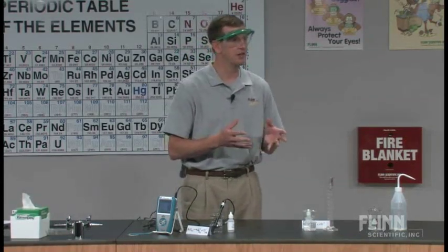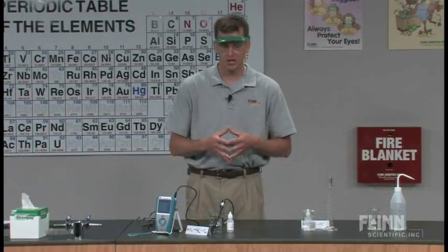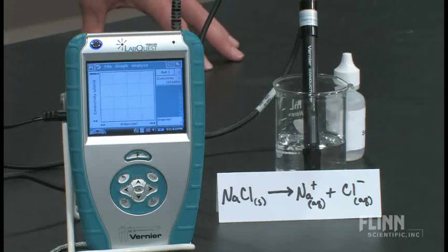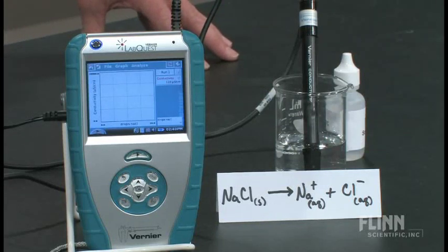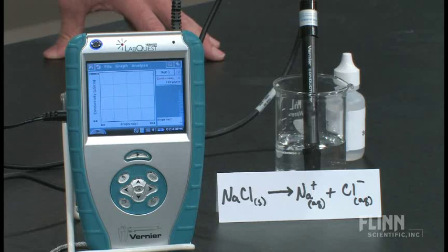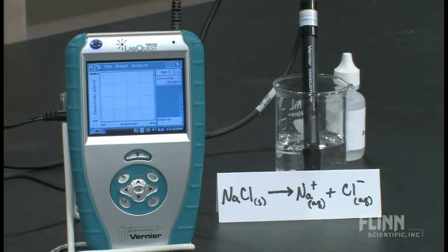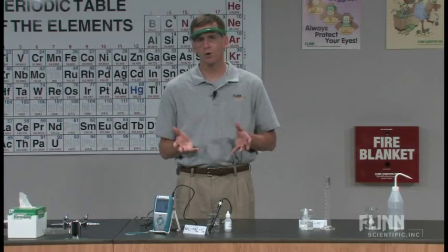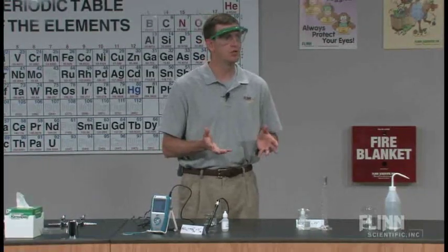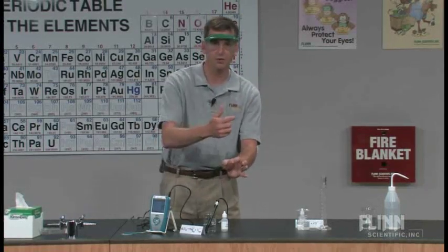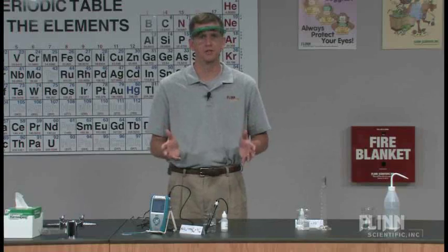This is something that kids don't often get a chance to see. We're going to use a conductivity probe hooked to a LabQuest that's manufactured by Vernier Company. That will give us a quantitative reading of the amount of conductivity taking place in our solution. Normally, in most classrooms that I see, we can do this on a qualitative basis with the little probes that go in and light up with red and green lights, and that's a great way to do it.